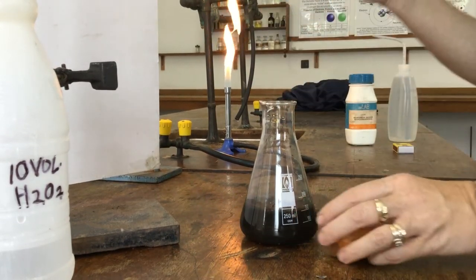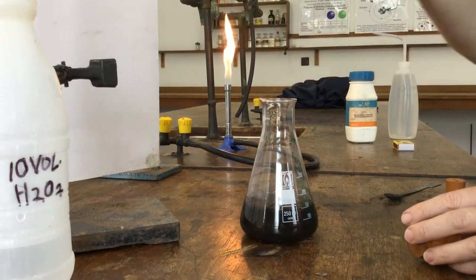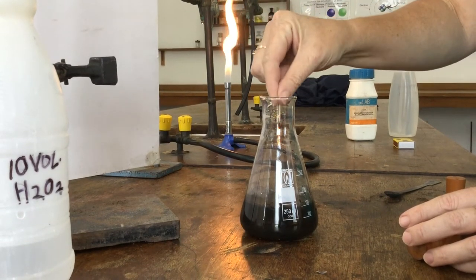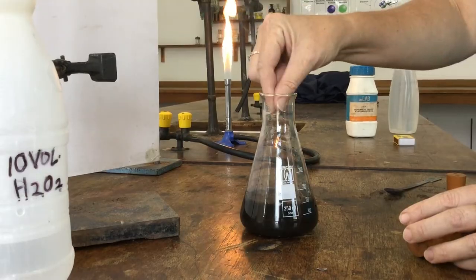Once we have a glowing splint, as we hold it in the mouth we should see it relight. And every time we put the glowing splint and plunge it into oxygen, it relights.